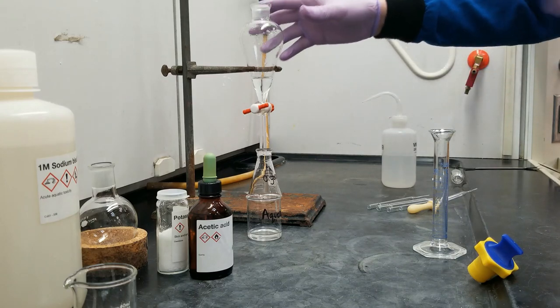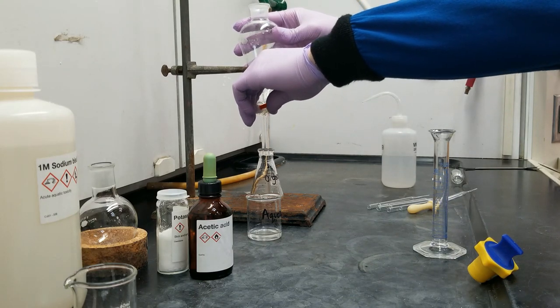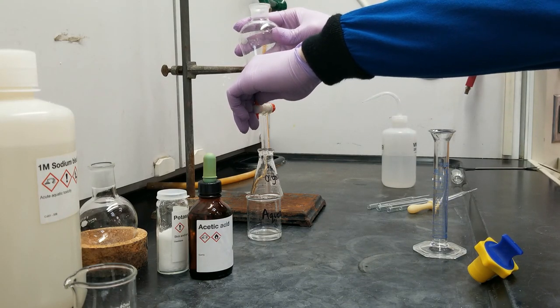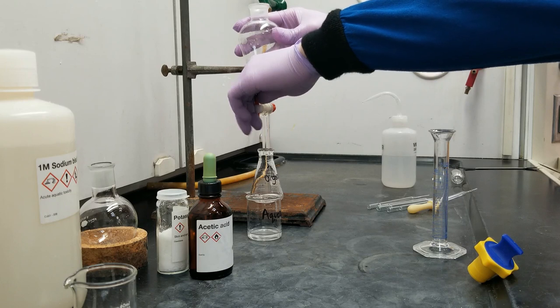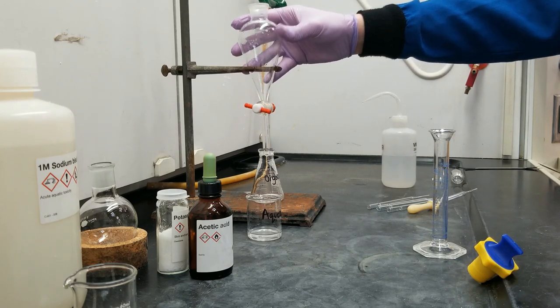So I have this container for my aqueous layer. Aqueous is out, I'm going to collect the organic. And there's my organic layer.